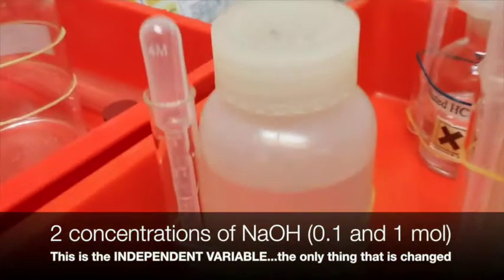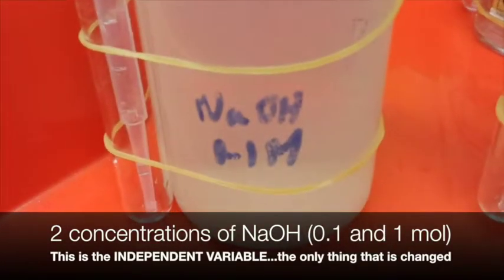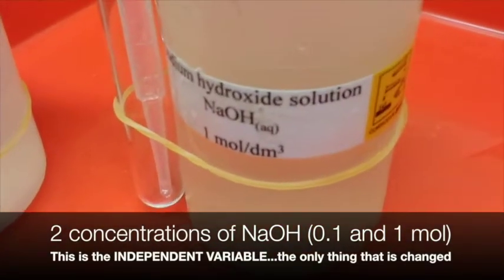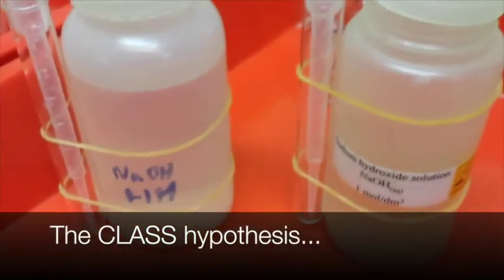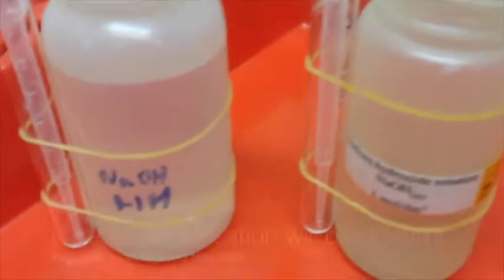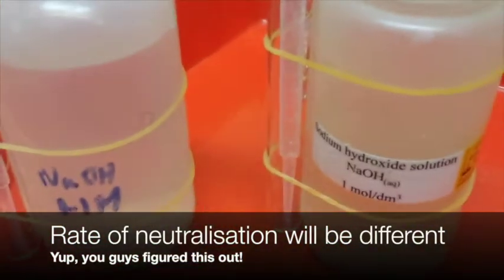What we're using, we're using two concentrations of sodium hydroxide. So we have 0.1 mole and 1 mole. We talked about our class hypothesis, and you guys figured out that the rate of neutralization will be different.